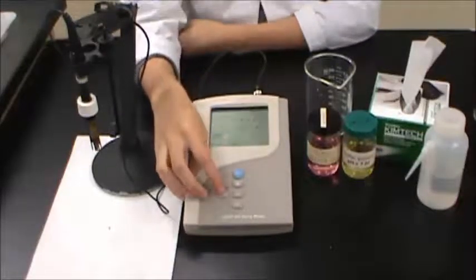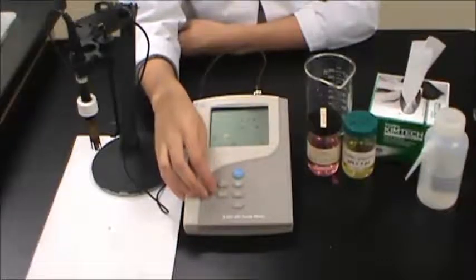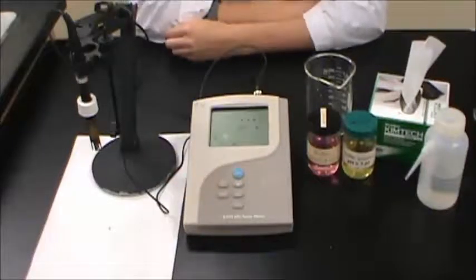Press Cal, then clear and clear again on the instrument to remove the values of any past calibrations.